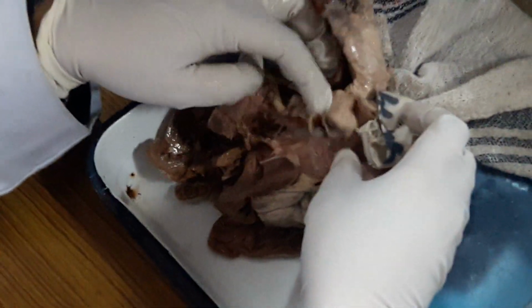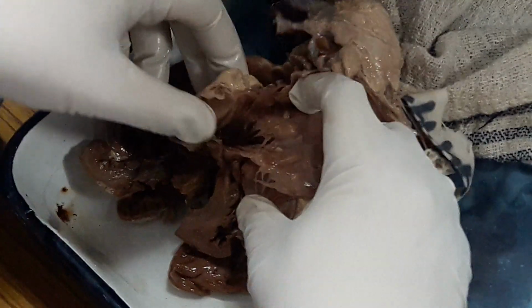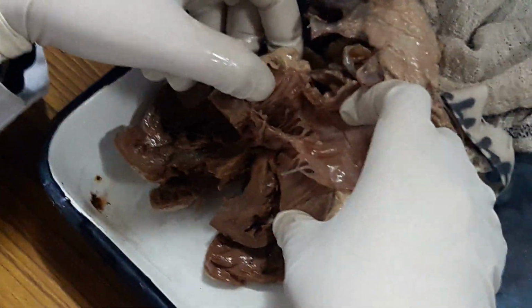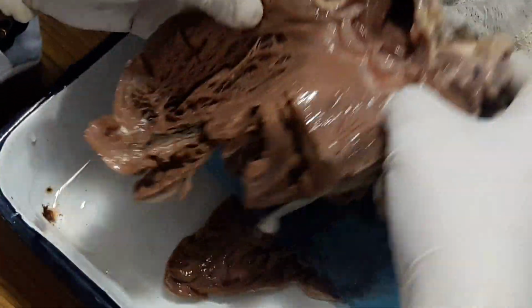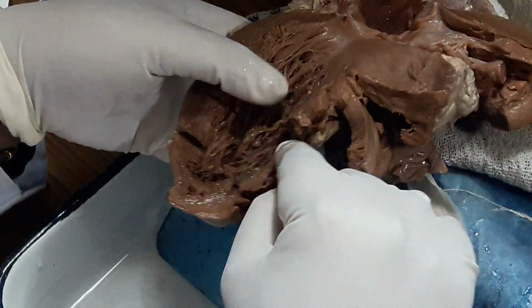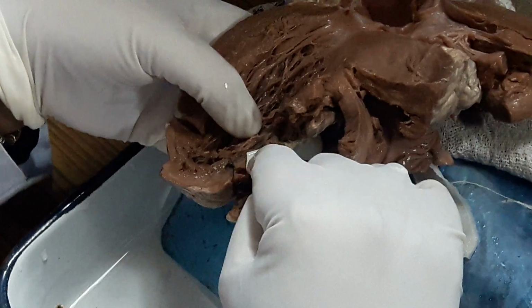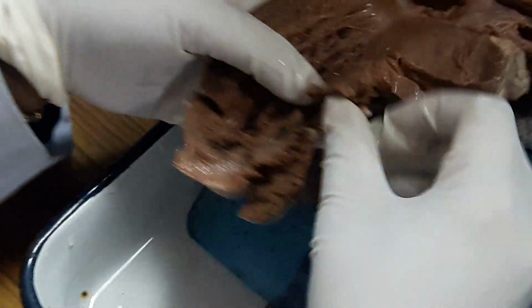Now in the left side also there is no valvular pathology as such. You can see the mitral valve. Sometimes in case of myocardial infarction, what can happen? The papillary muscle might get ruptured. Okay, that complication is not here. Now in the myocardium, if you see, in the anteroseptal region, there is a necrotic area having a blackish hemorrhagic look.